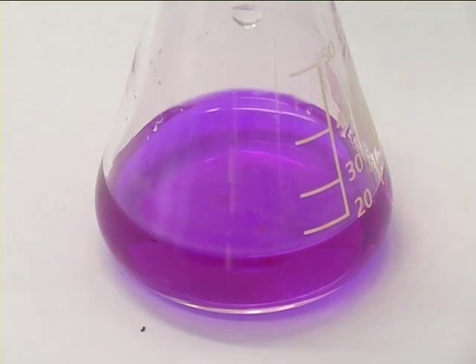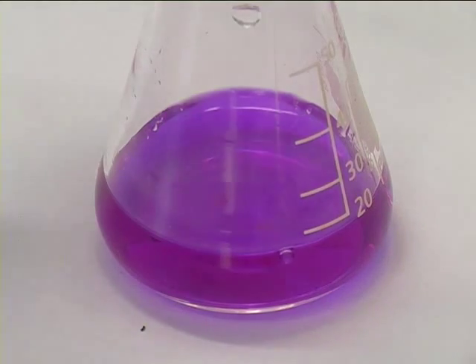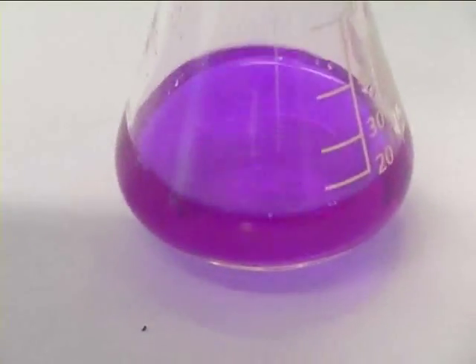Now you have a rough guide to how much volume is required. You will then do the actual titration, ensuring you swirl it at all times.